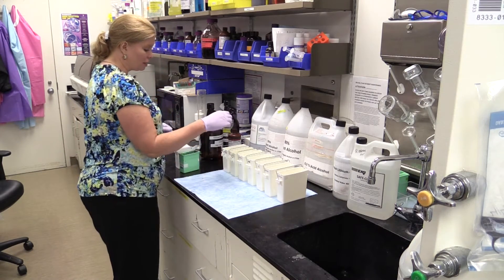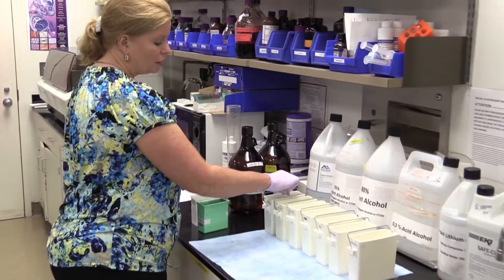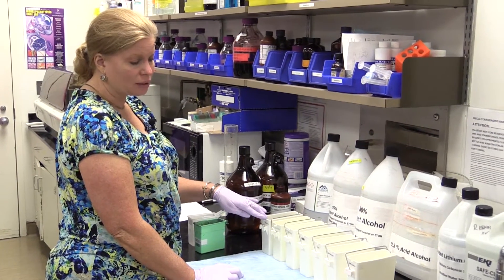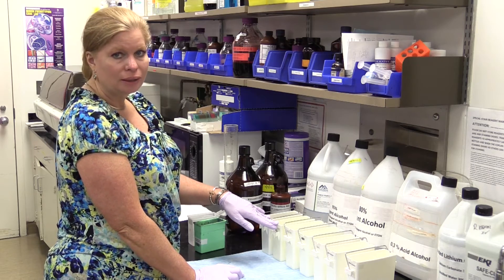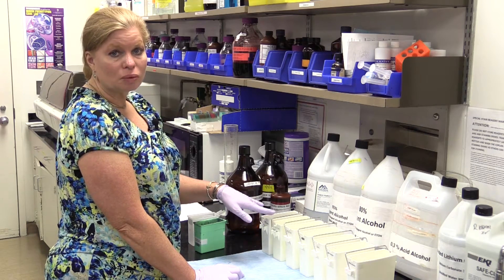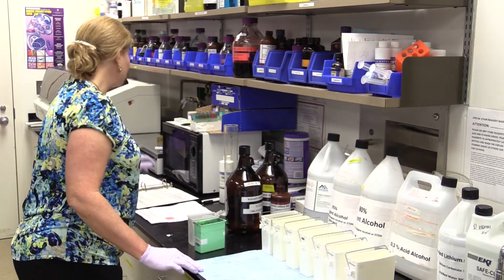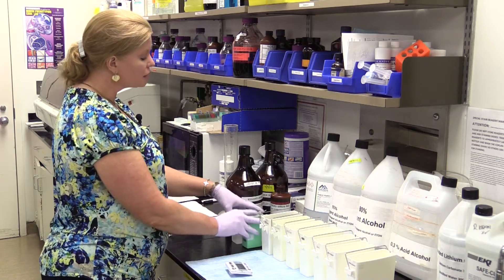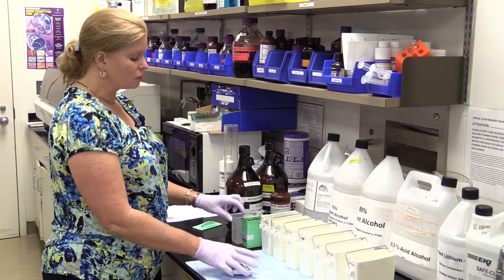So let's get these started — six minutes each since we're using SafeClear, which takes a little bit longer to deparaffinize. If this were actual xylene under the hood I would do each of these three stages five minutes each. In the meantime, while this is going through its five minutes, I'm going to start mixing my Weigert's hematoxylin, which is the first step of the Picrosirius Red.